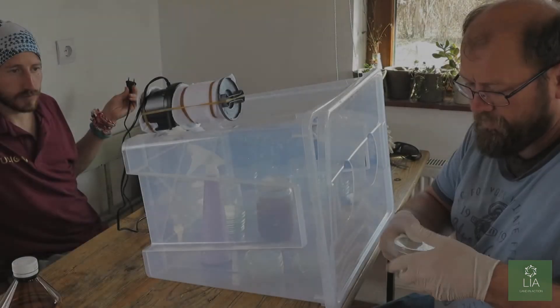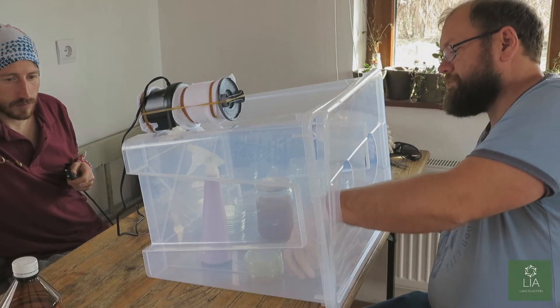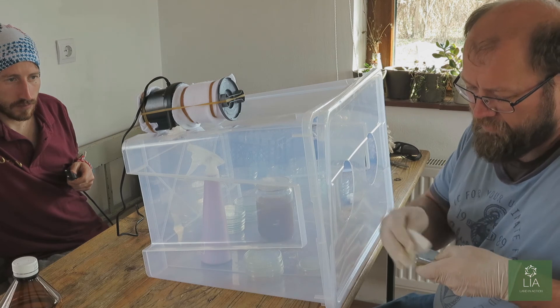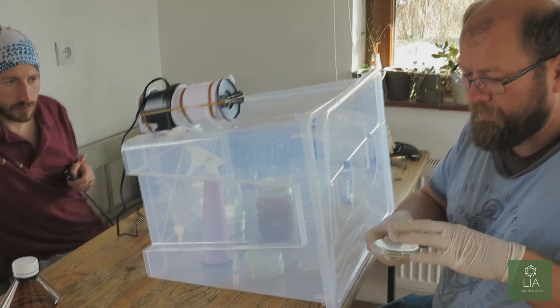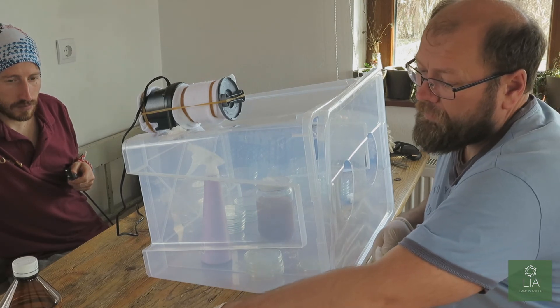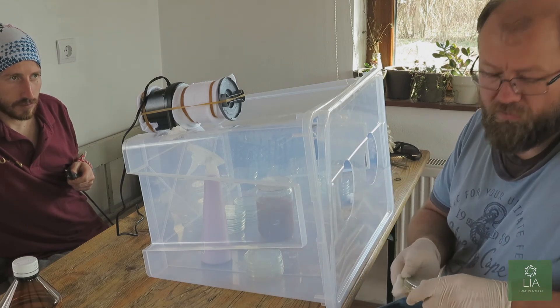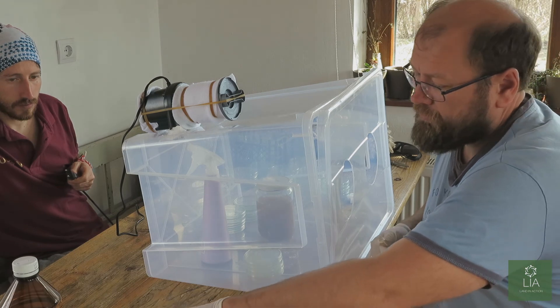Once we've got those Petri dishes, we can leave them on the side now to cool down. We don't want to open up the Petri dishes anymore — they need to be sealed until we're ready to inoculate them. You want basically around about a millimeter of agar on the bottom of the Petri dish, because that's all you need for the mycelium to colonize the dish.